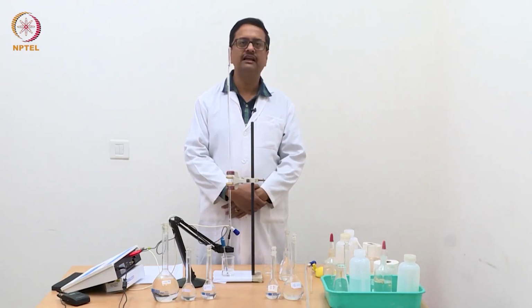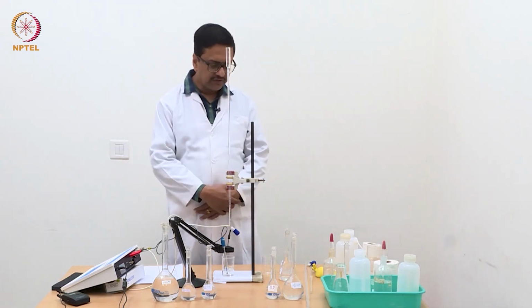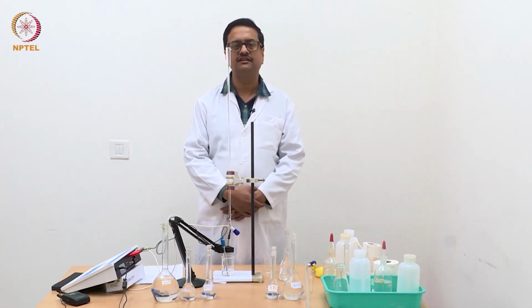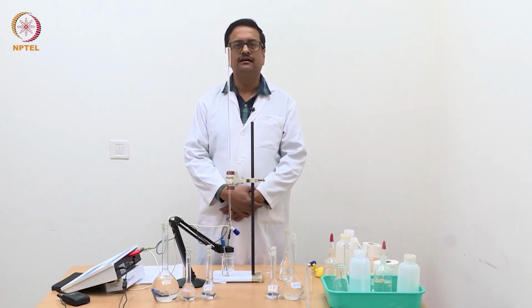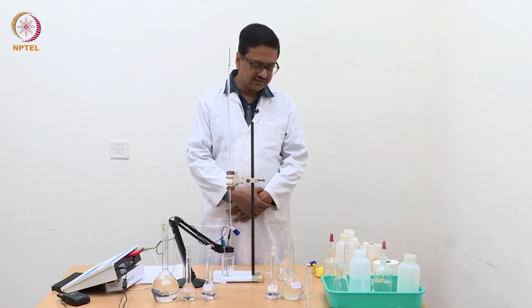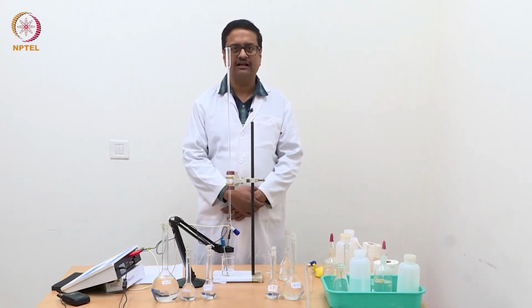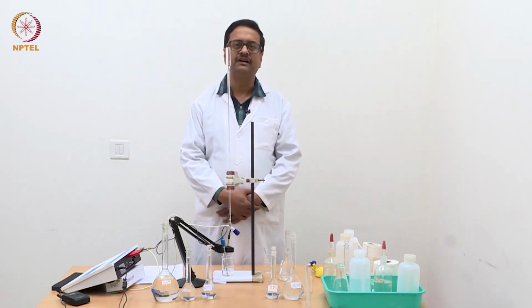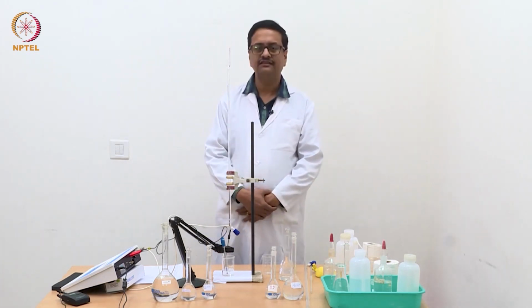Welcome back to the experimental session of elementary electrochemistry course. In the previous few videos, we have shown you a few conductometric and potentiometric titrations, and two conductometric titrations on weak acid and strong base, and strong acid and strong base. And now in this third experiment, we are going to combine two types of titrations.